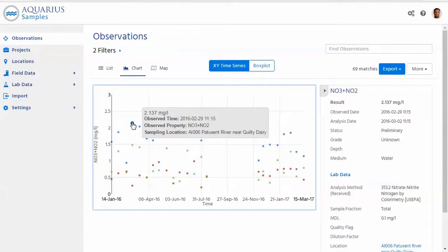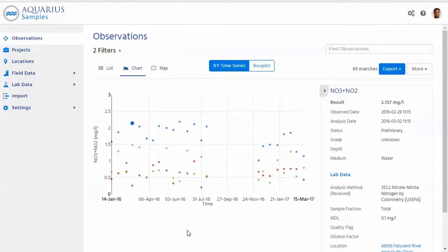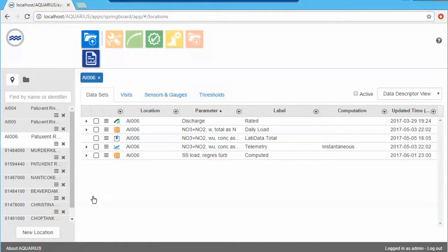But for this example, we're interested in looking at this data together with the continuous data in Aquarius Time Series. So I will just jump over to Aquarius Time Series real quick. And by the way, this is a whole new platform that maybe some of you have seen, some have not seen. And this is basically how continuous data is managed within the Aquarius software solution.